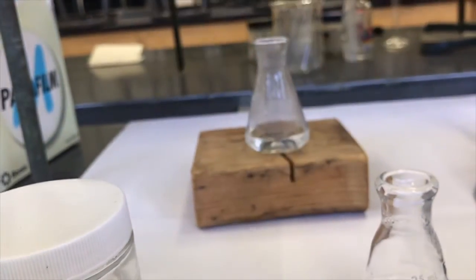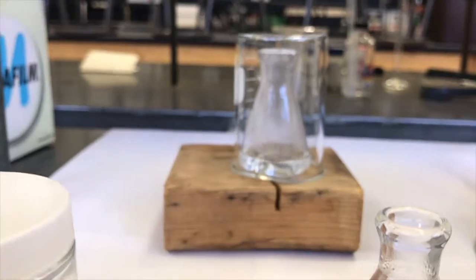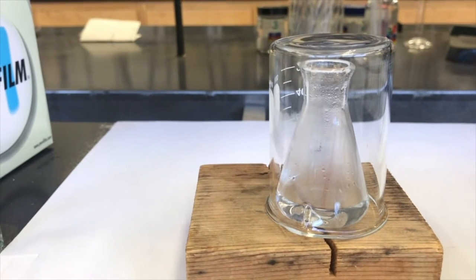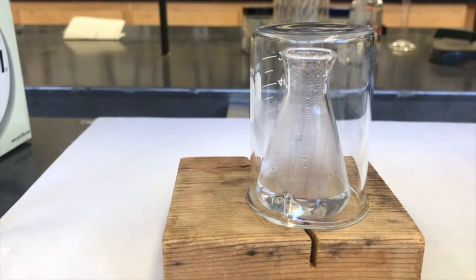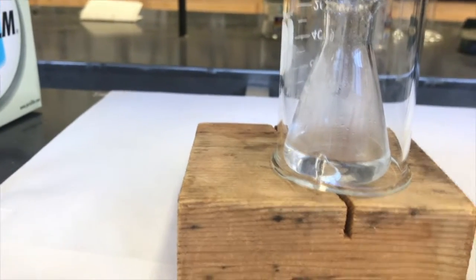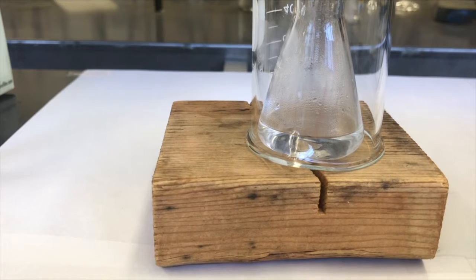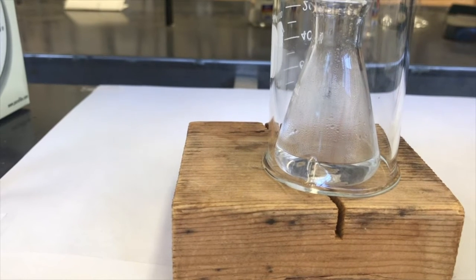So I'm going to take it over to this wooden block to cool slowly, and I'm going to slow it even more by putting a beaker over the top of it. It's not sealed, it still has that opening on the bottom of the beaker there, but this will allow a fair amount of methanol vapor to build up in the beaker, which will slow evaporation, which will slow the cooling, evaporative cooling, and if you cool your solution slower, you'll get more pure crystals. They'll crystallize slower, and they'll have an ability to crystallize and dissolve, and when an impurity gets caught in the crystal, it has time to dissolve back out, so you can get a more pure crystal.